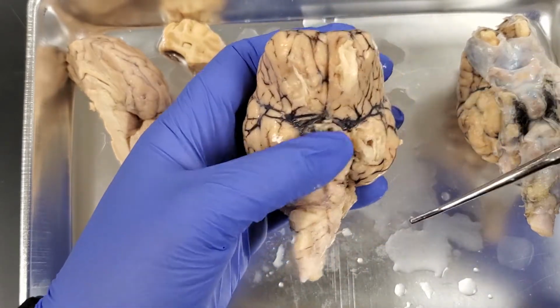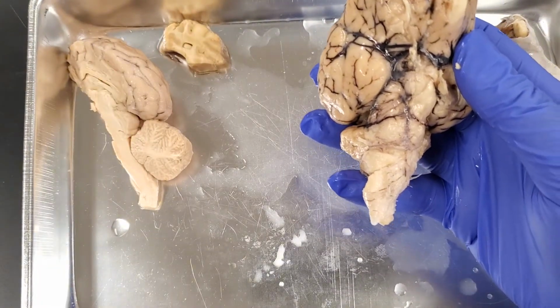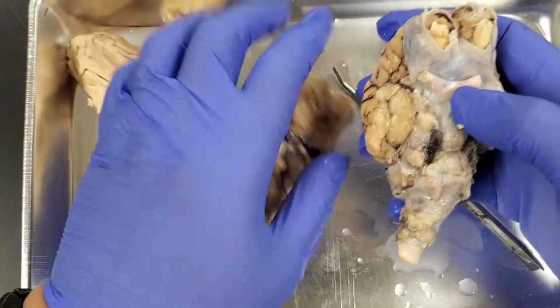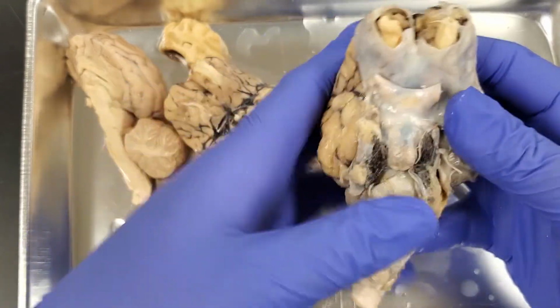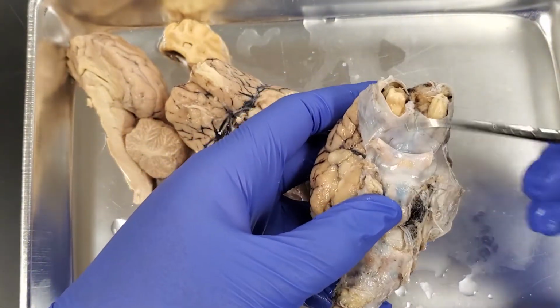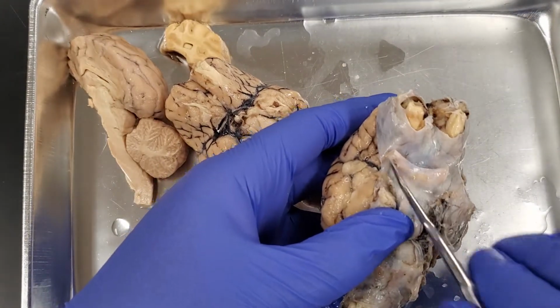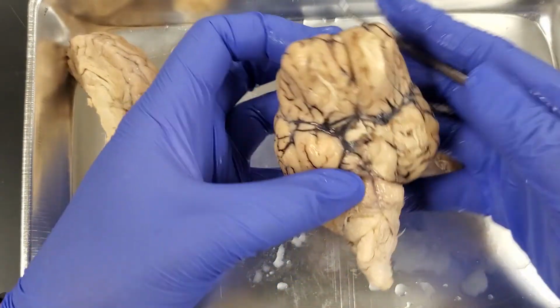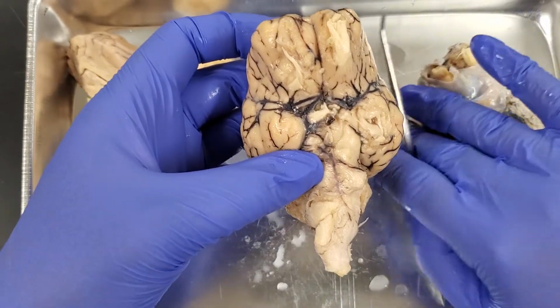The other things that we're going to see here when we're looking at this side of the brain is the optic chiasma, which is more visibly seen on this one here. The optic nerve is actually going to cross over to go to the opposite side of the brain. You can see this right here. This area right down here is actually where those two cross. That's the optic chiasma. It's been kind of broken down here, but you can see remnants of it right here and right here. So that's the optic chiasma.